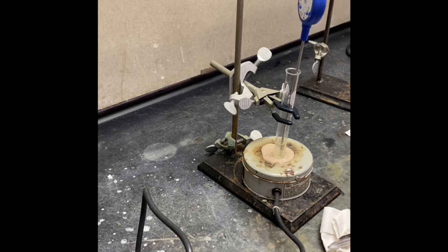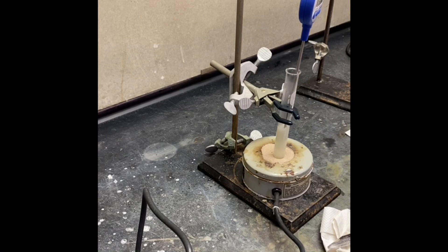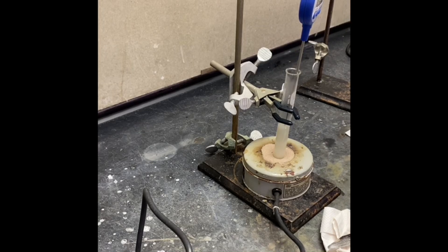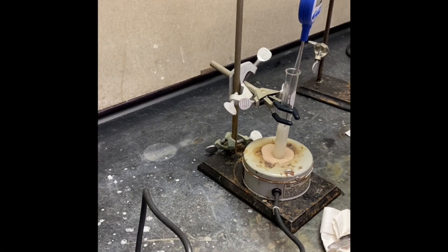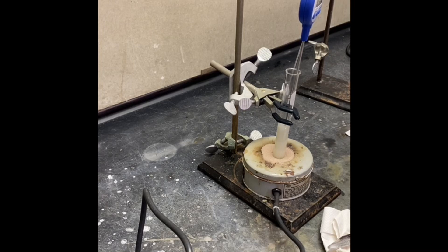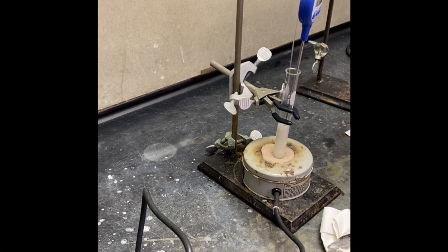I'm going to use a digital thermometer for that. Now we're going to apply the aspirator to the reaction flask. The temperature is around 105°C to remove the steam forming with the help of the vacuum, so that way the temperature can go up to 215°C, which is what we want. We're not measuring the inside of the solution; we're just trying to remove the steam forming in the reaction.